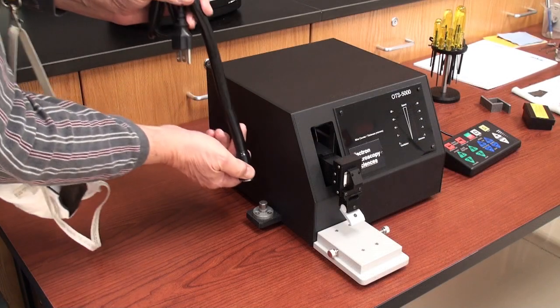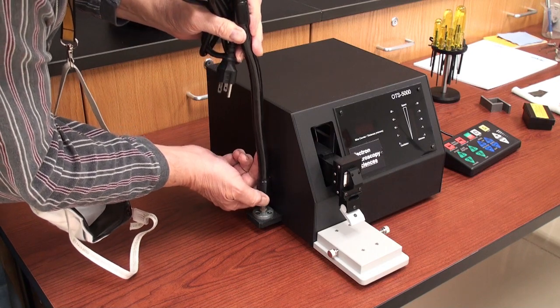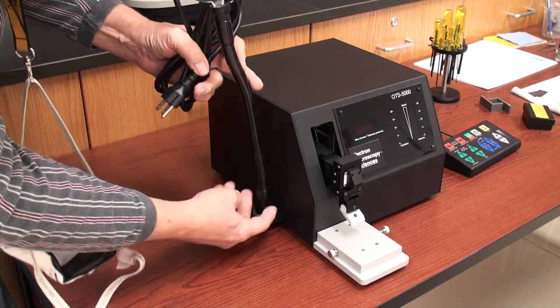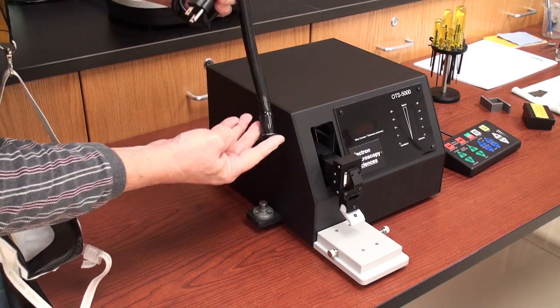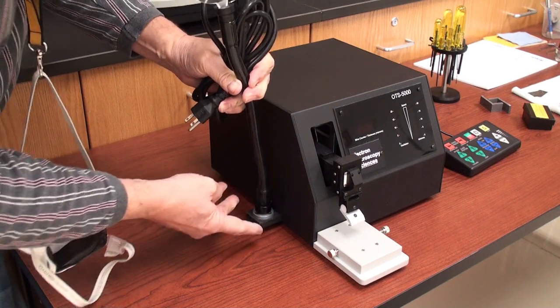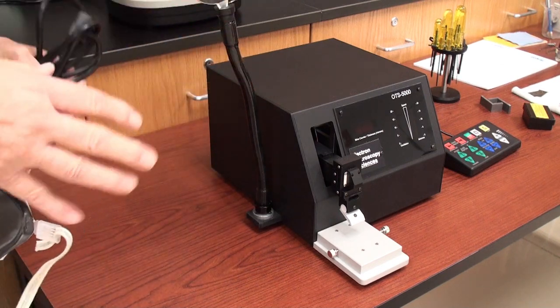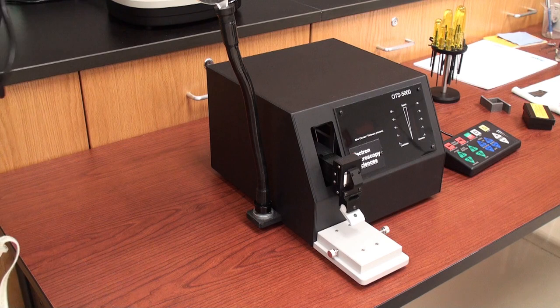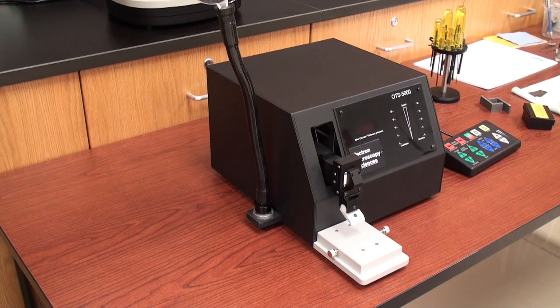First thing you do to mount the magnifying glass is you lift the quick disconnect here and it slides down over that post. My personal preference is I very seldom use that however other people might find it useful.